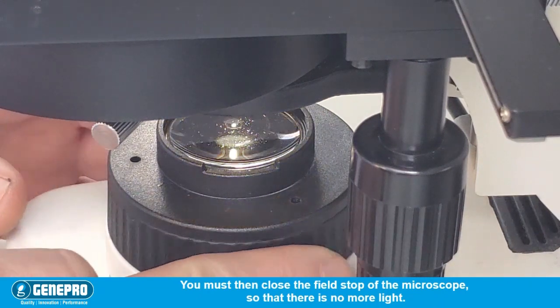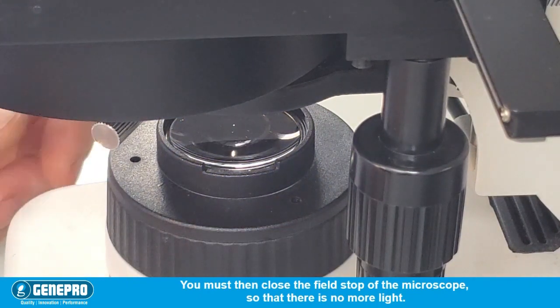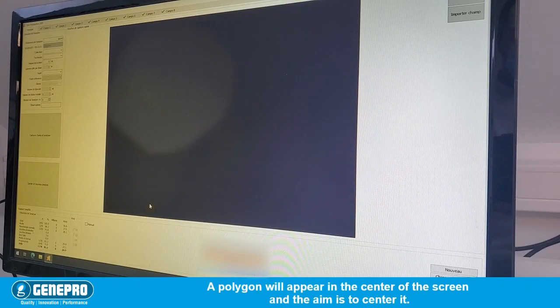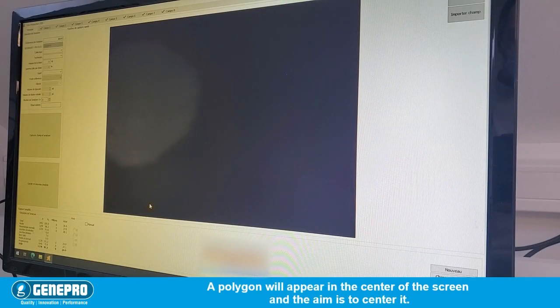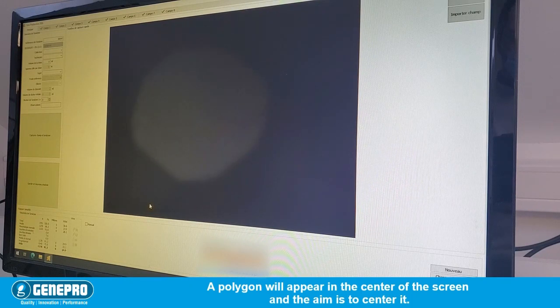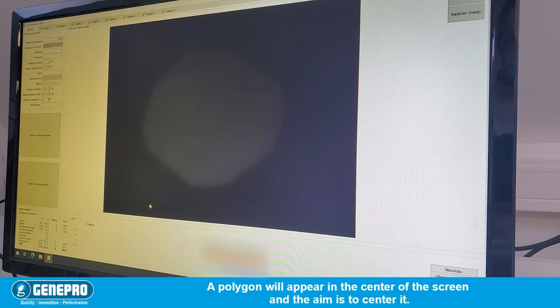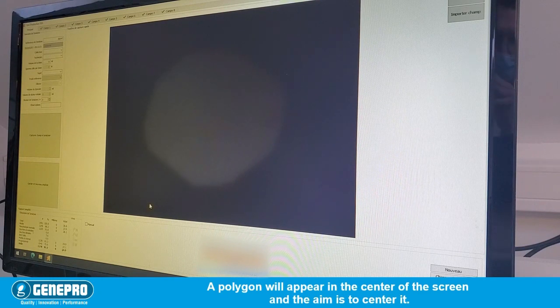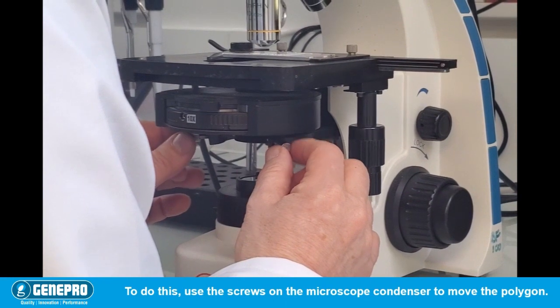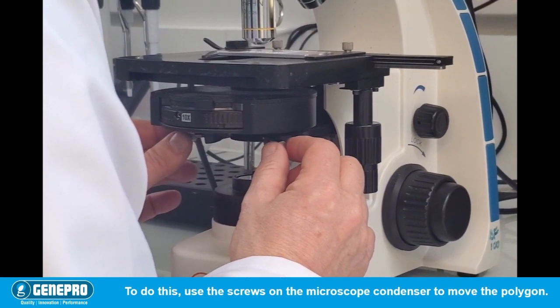You must then close the field stop of the microscope so that there is no more light. A polygon will appear in the center of the screen, and the aim is to center it. To do this, use the screws of the microscope condenser to move the polygon.